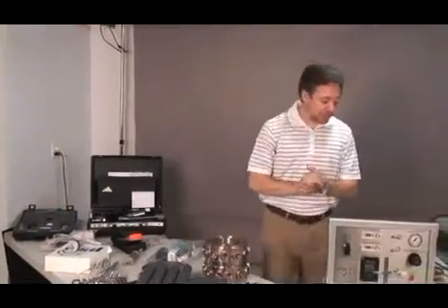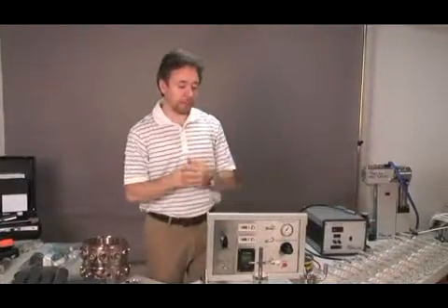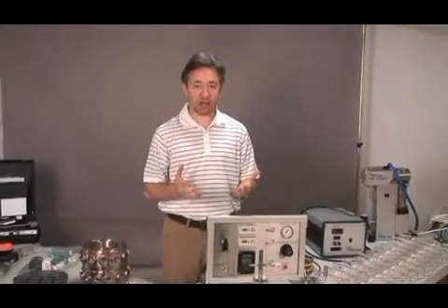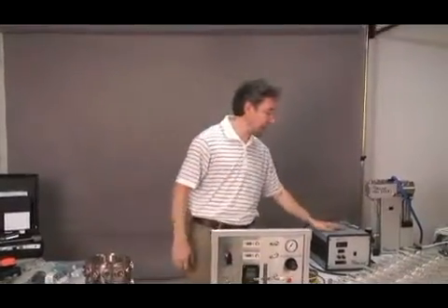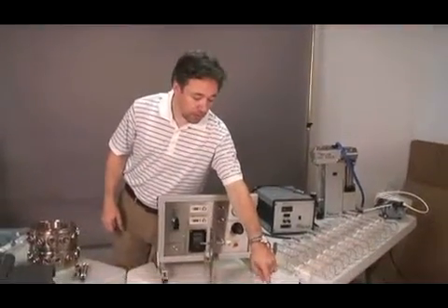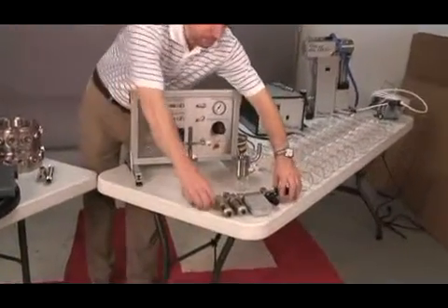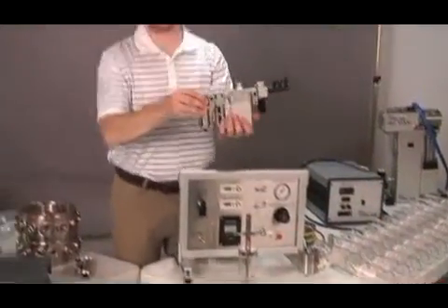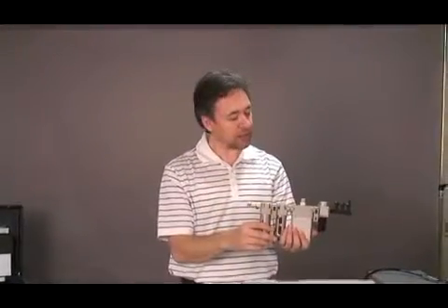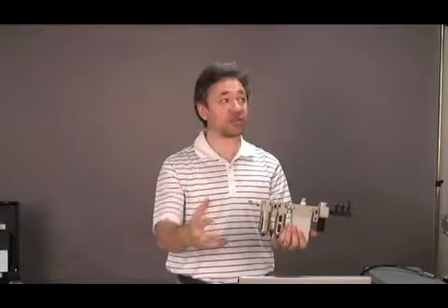And last but not least, in order to supply properly treated air, which is clean and dry, especially when you're running powder exposures, you are supplied a filter train. So it's a system to treat the air from your compressor, be that a dedicated compressor or compressed air from the building.